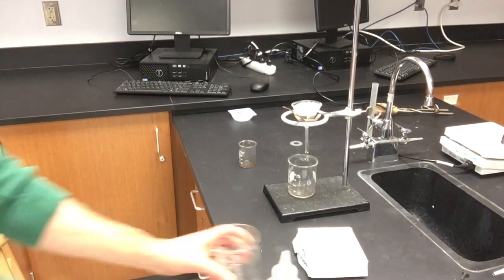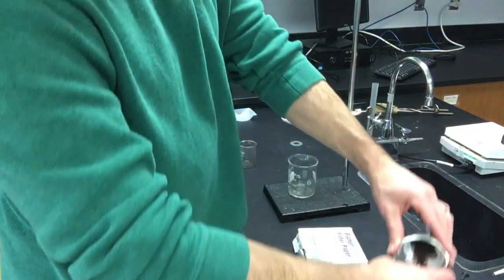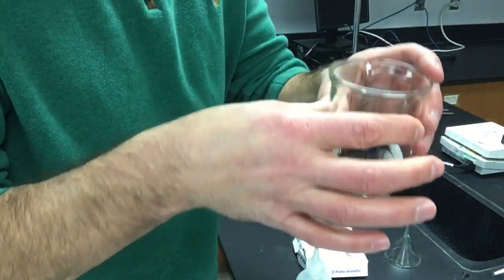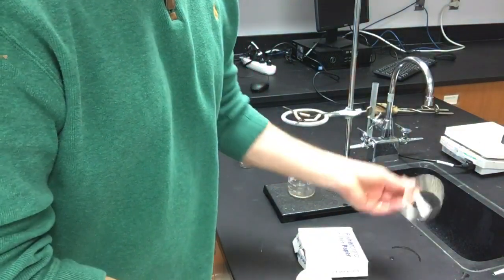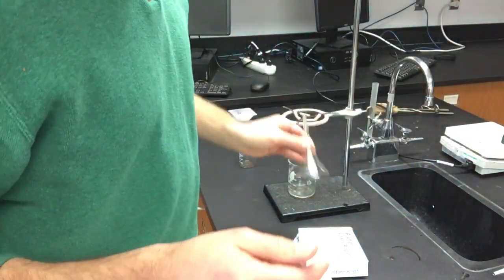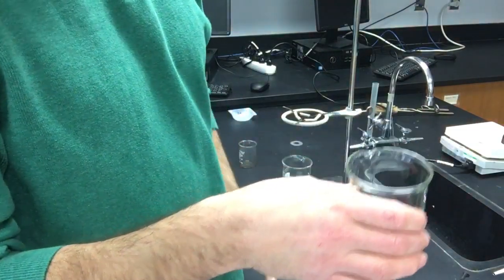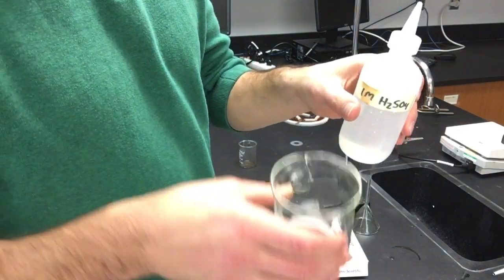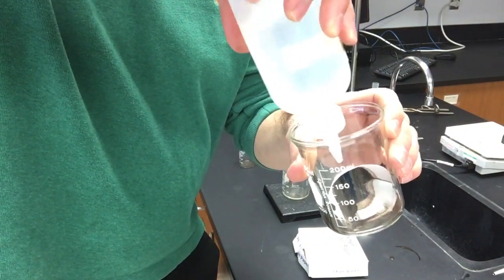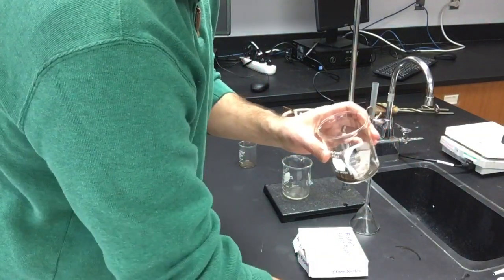When it's all done dripping, we're going to take this filter paper out. The filter paper is now in a beaker, so all the copper is right here — at least most of it. A little bit — look at my funnel — a little bit of black liquid right here, so that's some copper that I lost. Maybe a little bit got through; I doubt it but it's a possibility. What I'm going to do next is step four: I'm going to add sulfuric acid, put that right into the beaker. I only need a couple milliliters, so I added that.